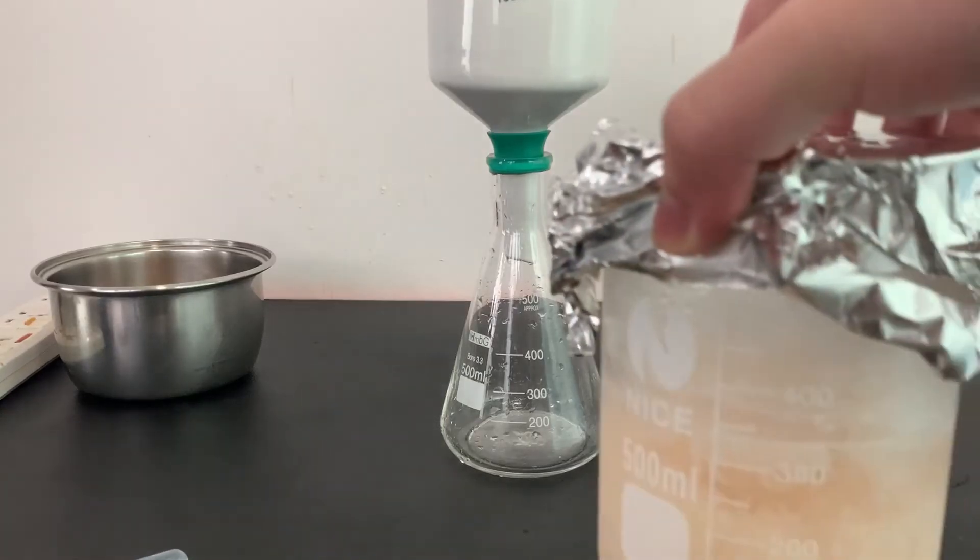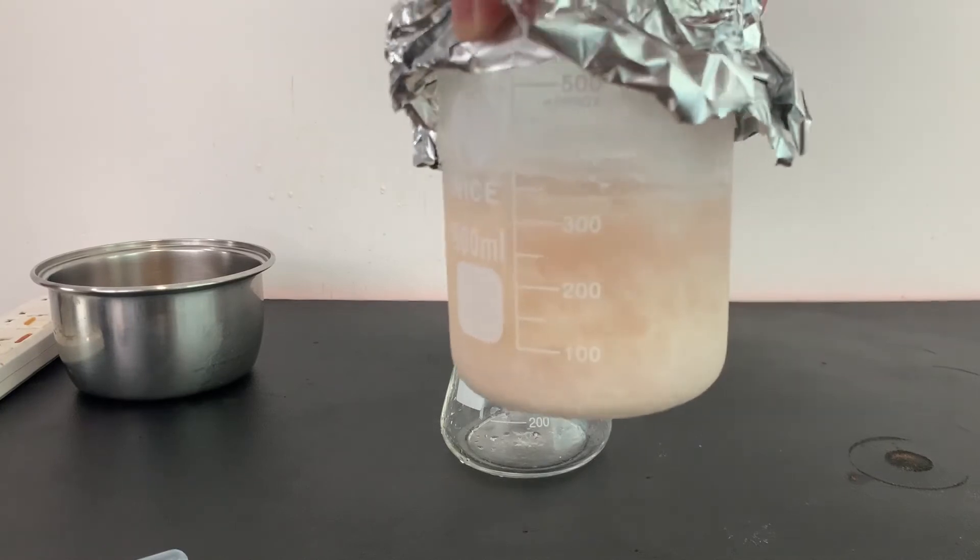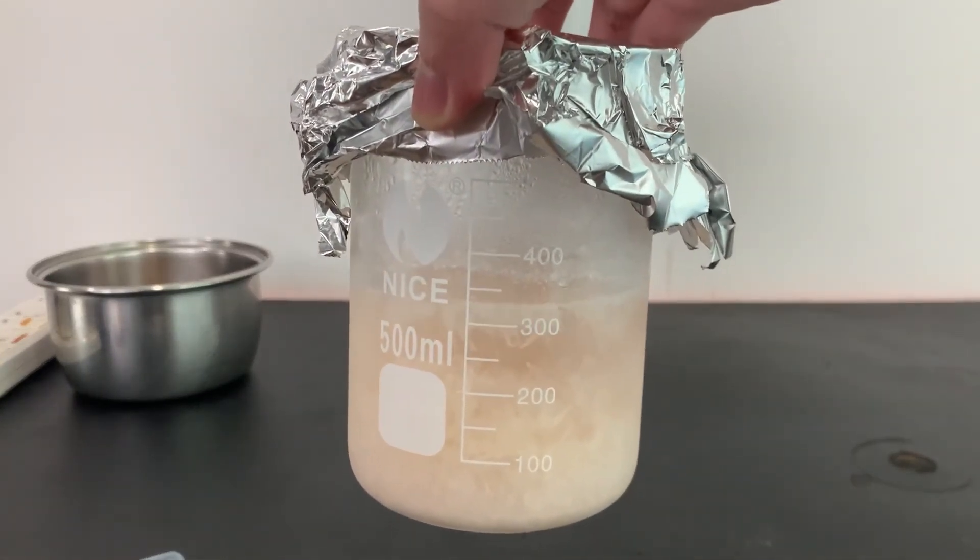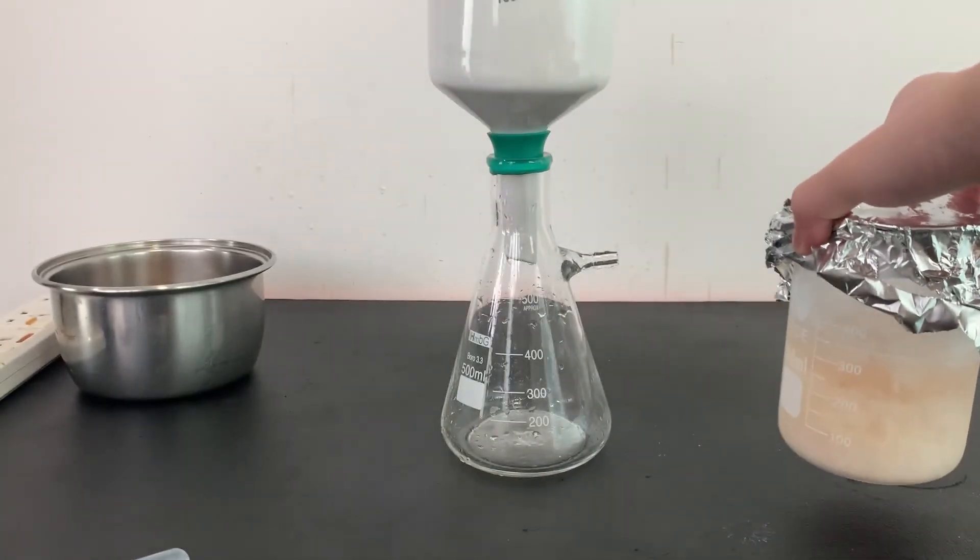The decanted acetanilide solution is then left to cool in the refrigerator for a few hours. After cooling, you can see a lot of acetanilide crystals.